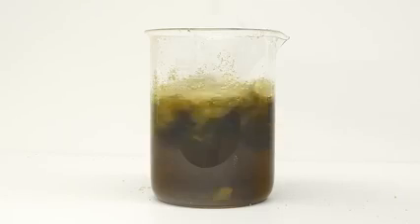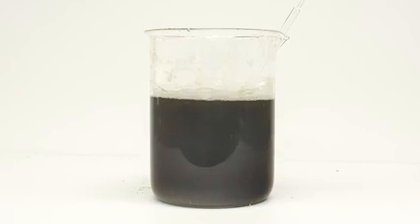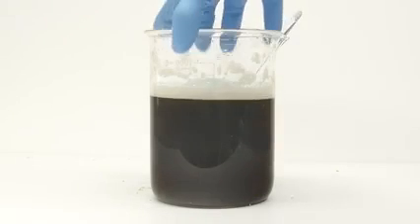I mixed it around and let it stir on its own for about 10 minutes, hoping that everything would dissolve. All of the powdered soap disappeared pretty quickly, but there were still some chunks floating around. These were larger pieces that I wasn't able to grind up very well, but I decided to include anyway. In hindsight, I probably should have just chucked them out, but in any case, I need to deal with them now. At room temperature, it was taking forever to dissolve, so I heated it up a little in the microwave.